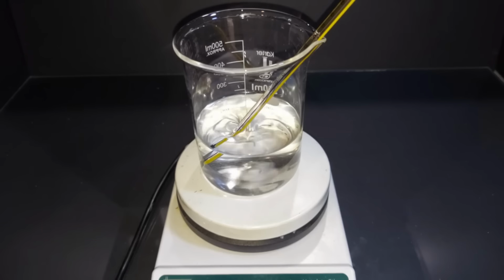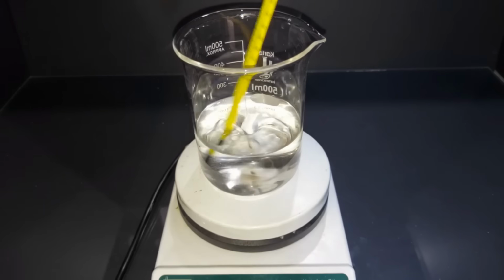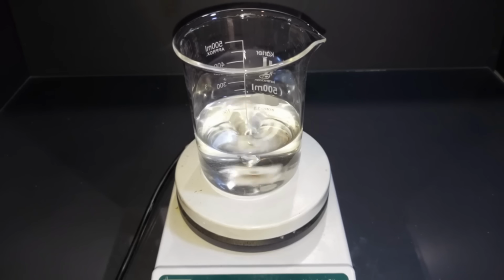Because oxalic acid does not like to dissolve in cold water, I turn the heat on eventually just to get it to dissolve, and I hit around 35 degrees Celsius, maybe 34 degrees Celsius. Either way, it all of a sudden dissolved very nicely. So I'm going to go ahead and remove this thermometer at this point. The potassium hydroxide should dissolve in there much easier.